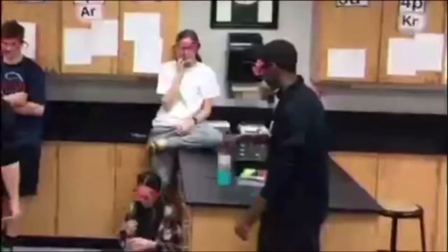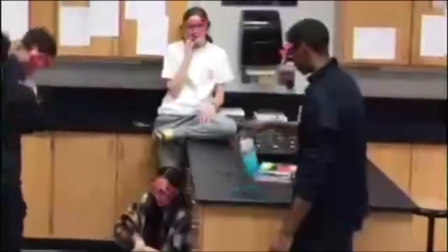Here, we have a young lady on her phone, which is definitely not allowed in lab. You could be talking to your boyfriend or whatever and accidentally spill ammonium on your foot or something. Absolutely no eating in the lab. It can also cause distractions as well. Also, Ms. Belmore hates it. Absolutely no flippy bottle.